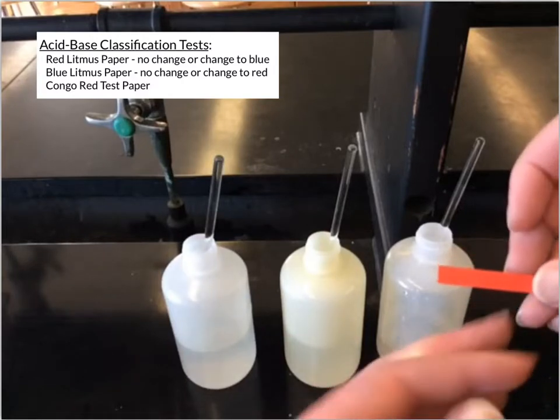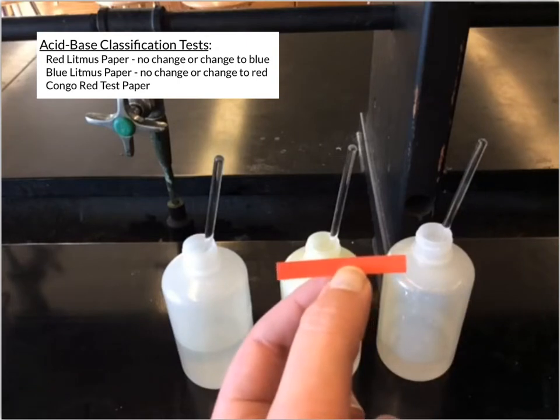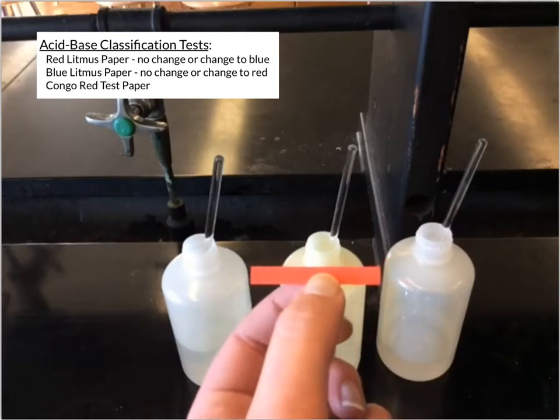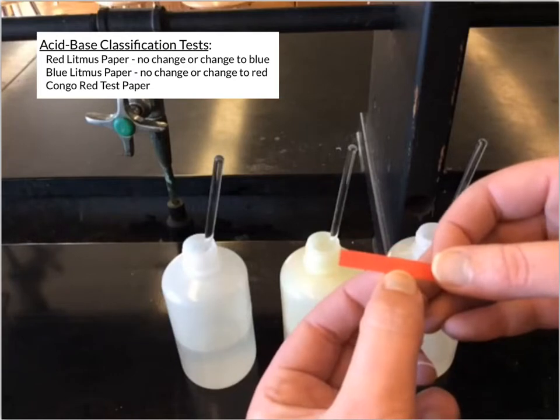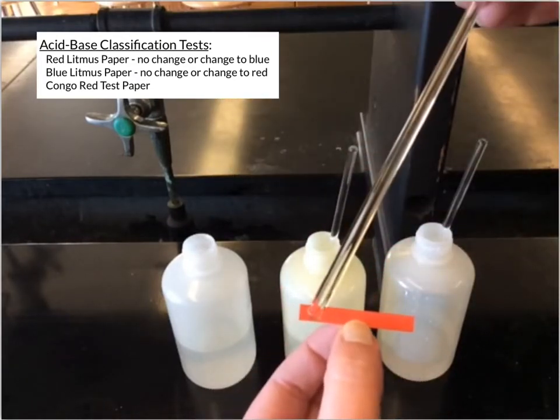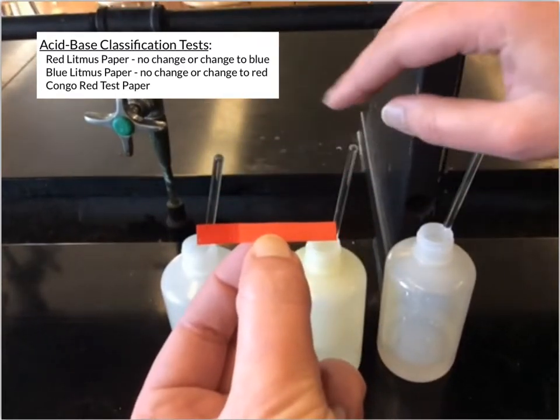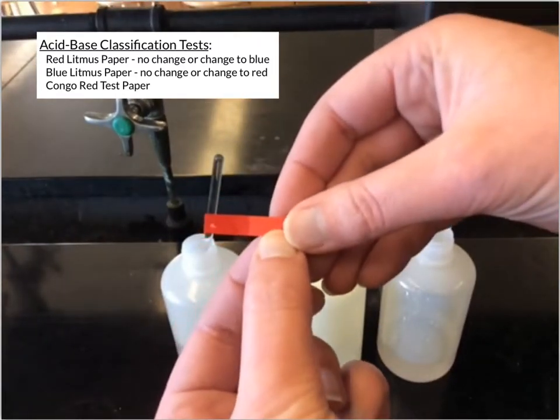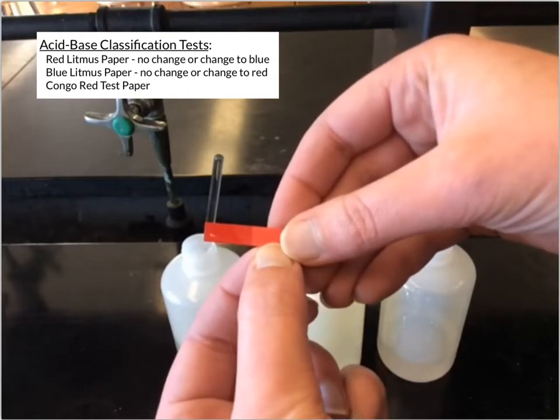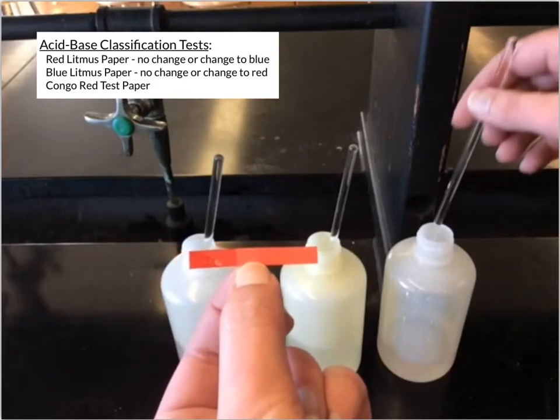Okay, and then we have another type of test paper, and that's called Congo red test paper. And so I could test that with a substance, and it could have no change. So again, it kind of looks darker, and that's only because it's wet. So there's no actual change in that paper.